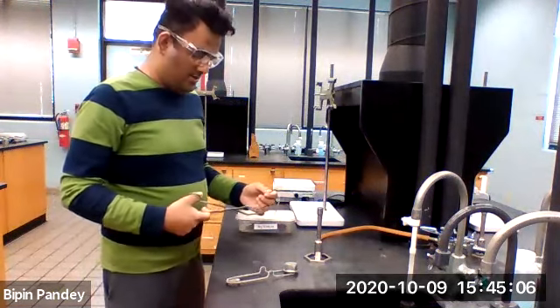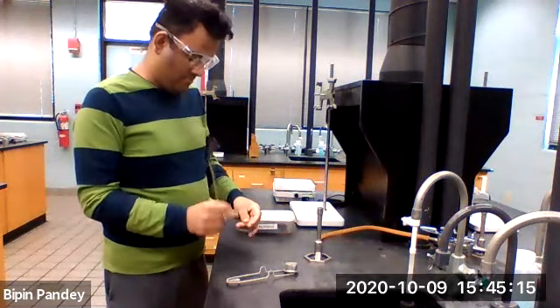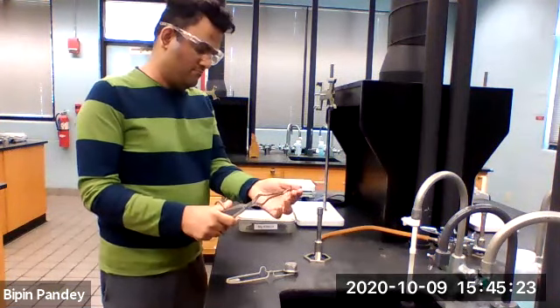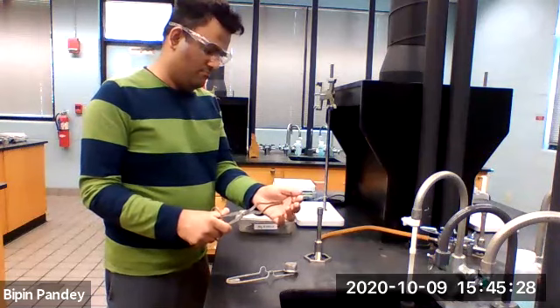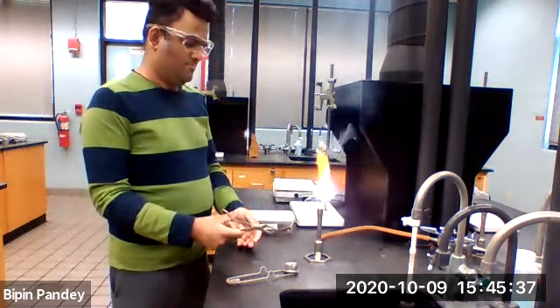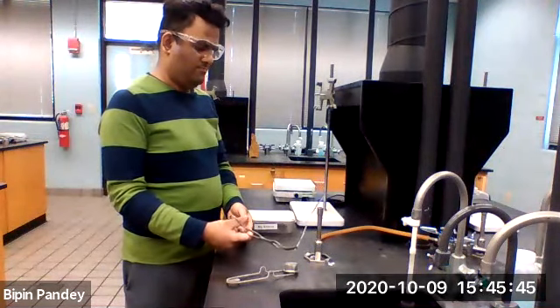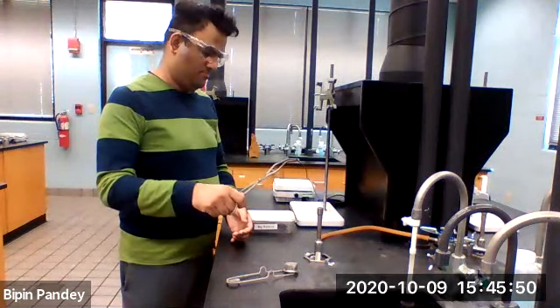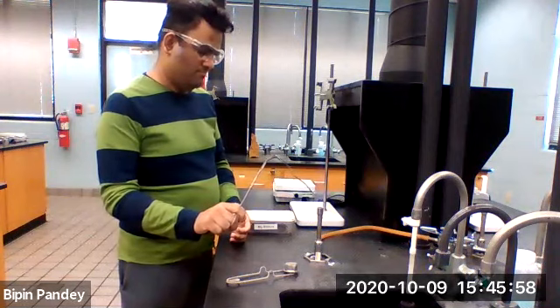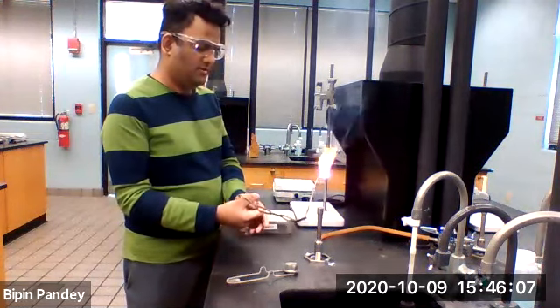You guys watch and see what happens. It burns with a white flame, as you can see here.